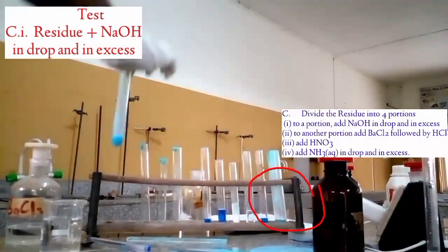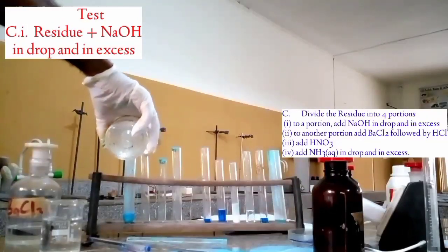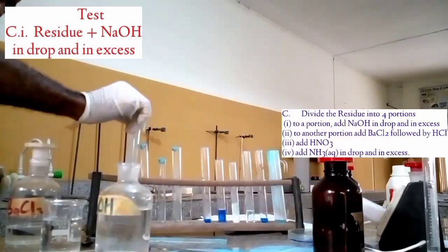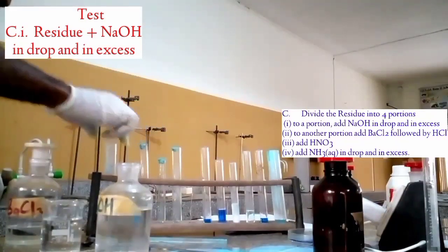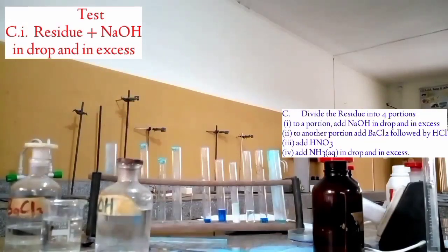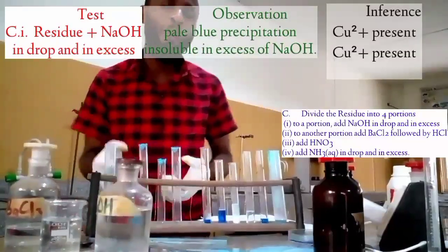Now add it in excess to see if it's going to form a solution. In excess. Still having the insolubility, that is, the precipitate is still showing. As you can see on the screen, that is what you're going to write as your observation and also what you're going to write as your inference. This is actually telling us copper is here.